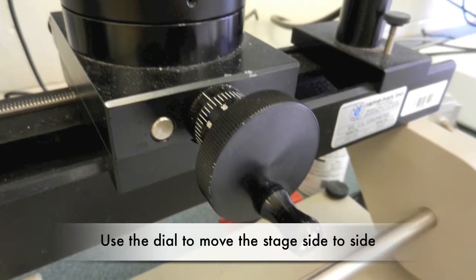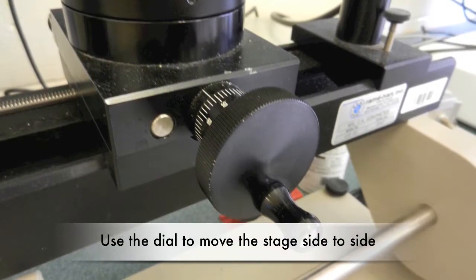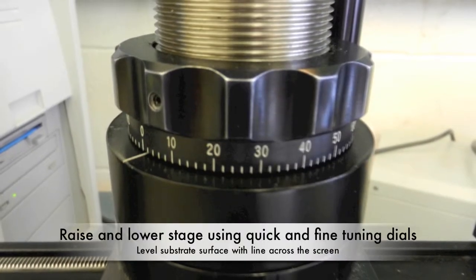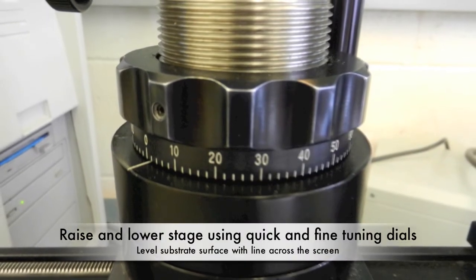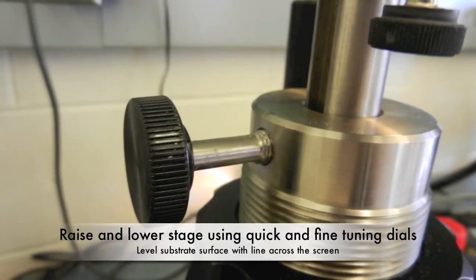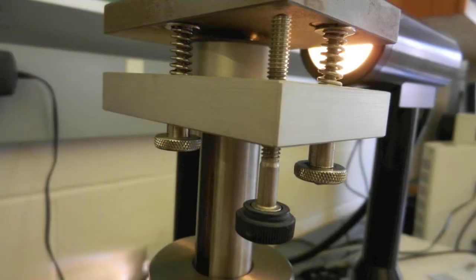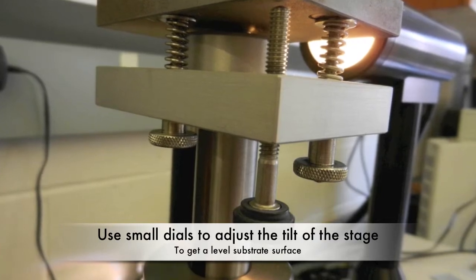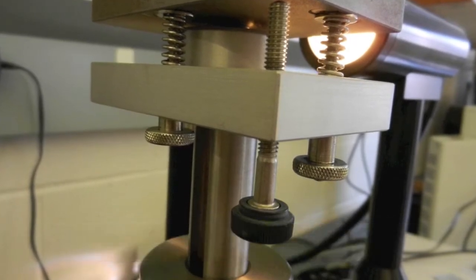Using the dial shown, move the stage side to side until you reach a fairly level surface on the substrate. Raise and lower the stage using the quick and fine tuning dials until the substrate is level with the line across the screen. Use the small dials below the stage to adjust the tilt of the stage and get a level substrate surface.